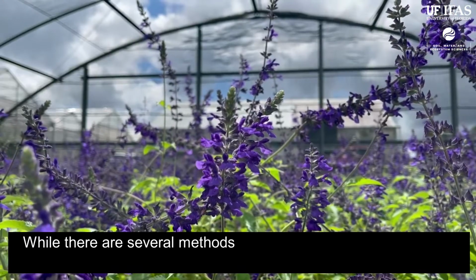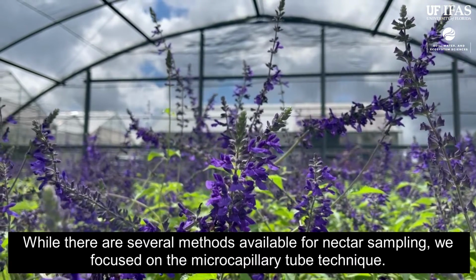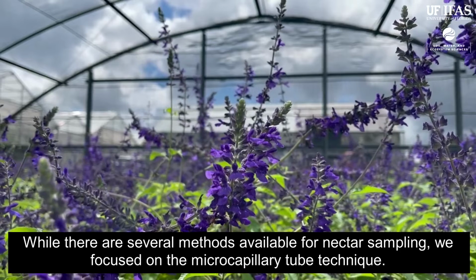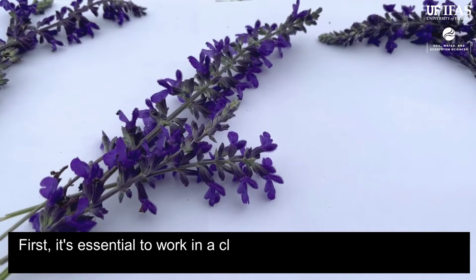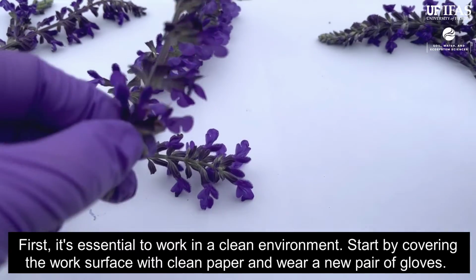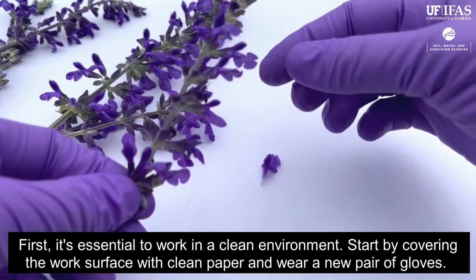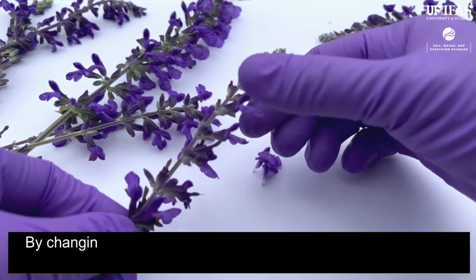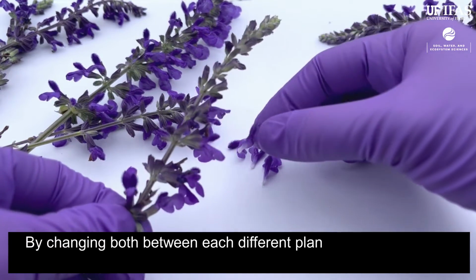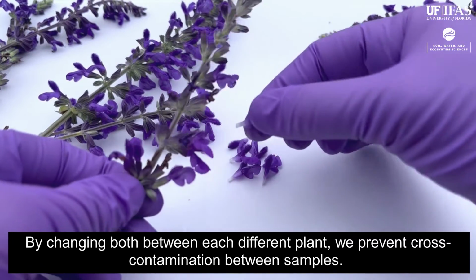While there are several methods available for nectar sampling, we focus on the microcapillary tube technique. First, it's essential to work in a clean environment. Start by covering the work surface with clean paper and wear a new pair of gloves. By changing both between each different plant, we prevent cross-contamination between samples.